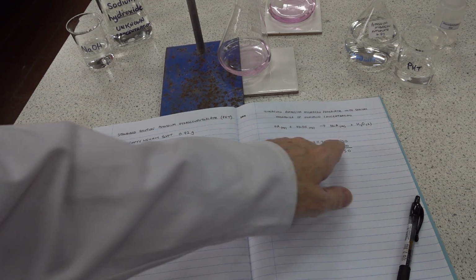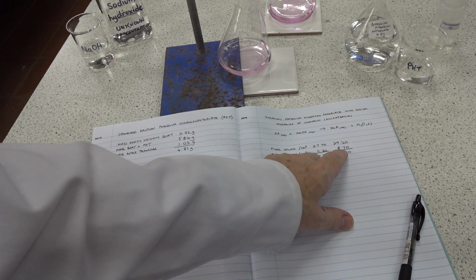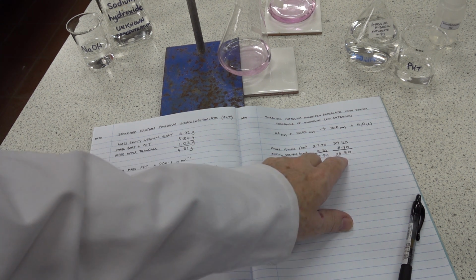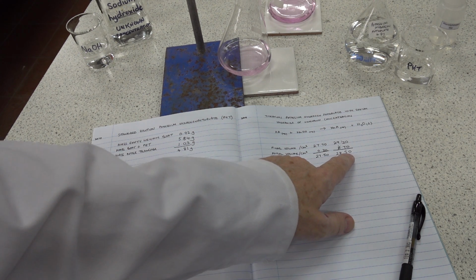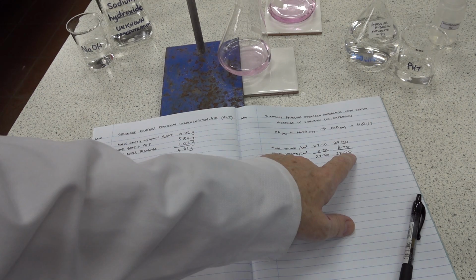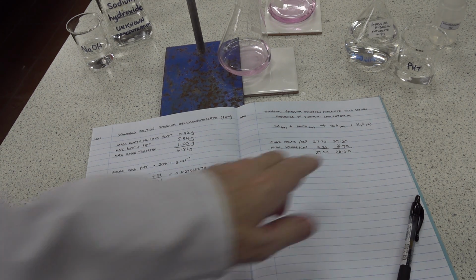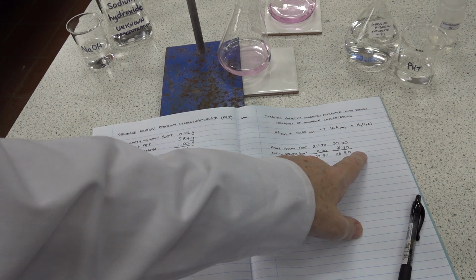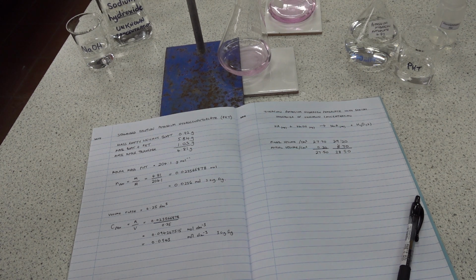So having recorded our final titration volume in our lab book, 29.2, we subtract the initial volume, 0.7, and we get a titration value here of 28.5. Of course, what we need to do now is to repeat the titration and keep repeating until we get to what are called concordant values. Those are two values within 0.1 of a centimetre cubed. So we'd have to do another titration looking to get 28.5 as our titration volume there.